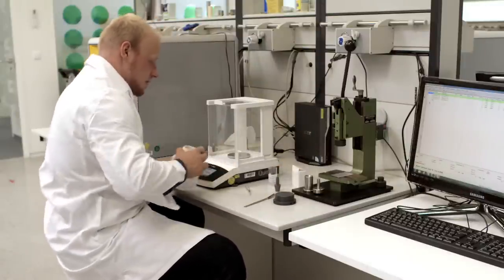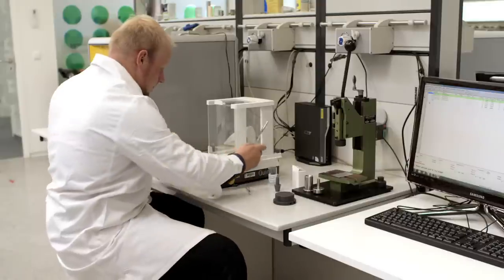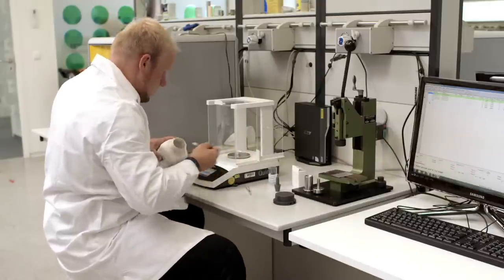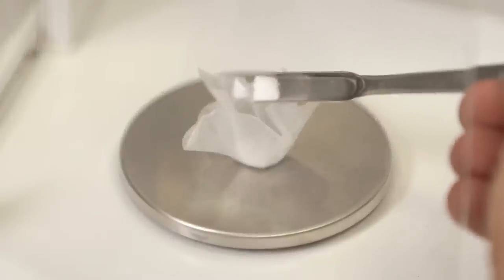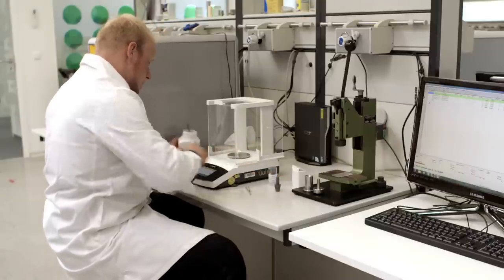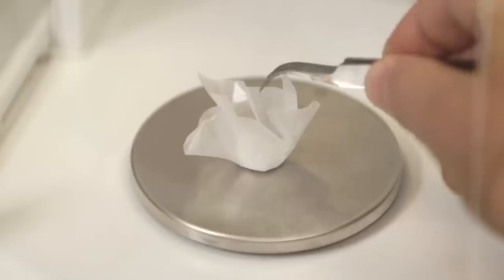First, we weigh in the samples with nitrogen-free paper. The paper will combust without forming ash, so in the case of pure organic samples, the volume of ash inside the ash crucible can be kept very low. This ensures a long working time before it needs to be exchanged.